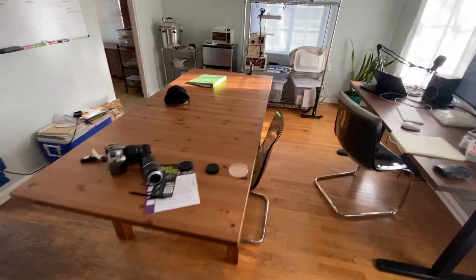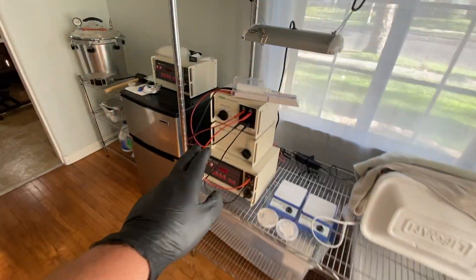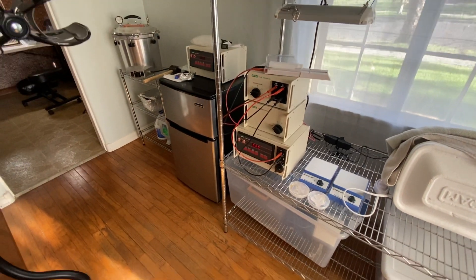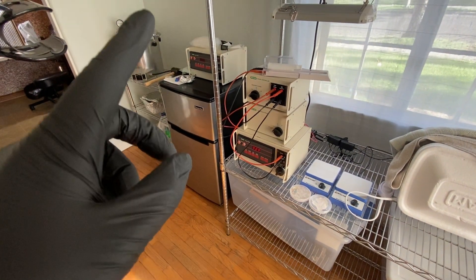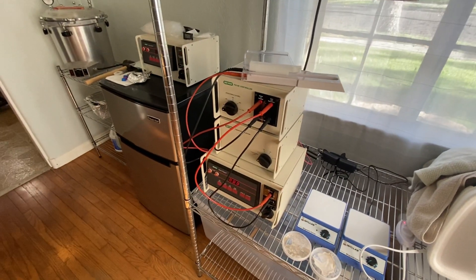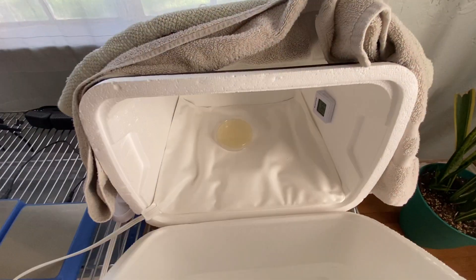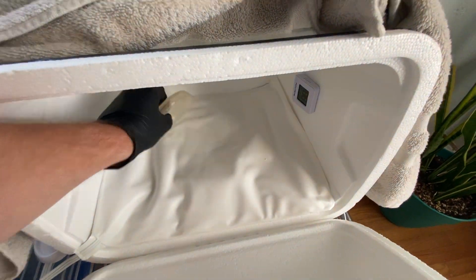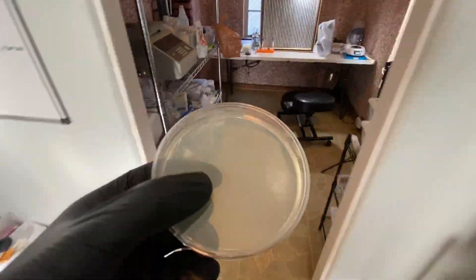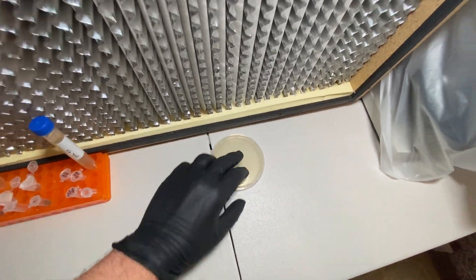Good afternoon everybody. We're back at it again today. If you saw the last video, we did some electroporation tests using cuvettes and they worked out great — we got some good results. So now I know what a good result looks like, and we're going to go back to using bacteria. This morning I prepared a new plate with about 150 microliters of freshly cultured DH5 alpha, so this should have a nice thin lawn that we can use to prepare some more electro-competent cells.